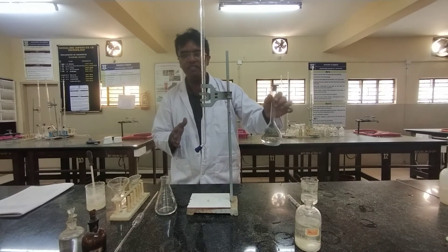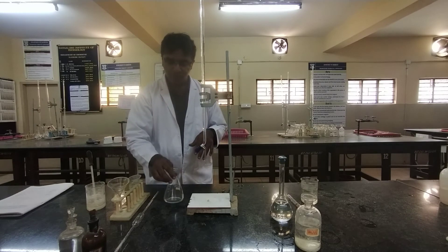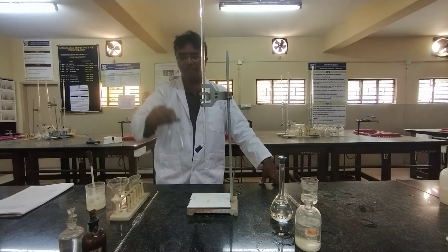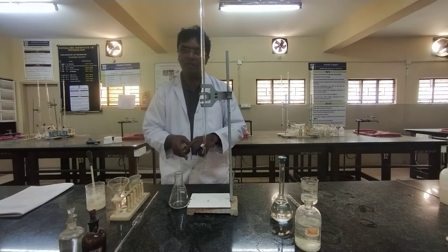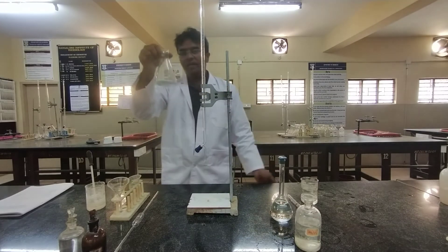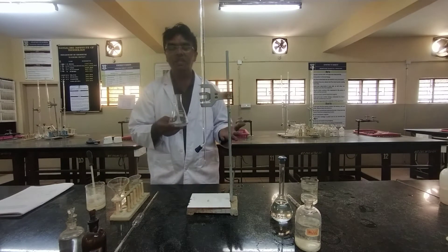Part one is preparation of 250 cm³ of the brass solution. In part two, you pipette out 25 ml of that brass solution into a clean conical flask. The concept is: the brass solution contains copper in the form of Cu²⁺ ions, because when the brass sample is dissolved by adding nitric acid, the copper atoms become copper ions. Therefore the brass solution contains copper in the form of cupric ions (Cu²⁺), and the number of Cu²⁺ ions depends on the percentage of copper in the original brass sample.